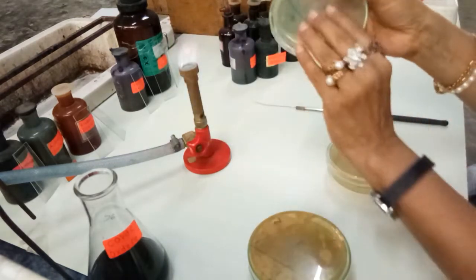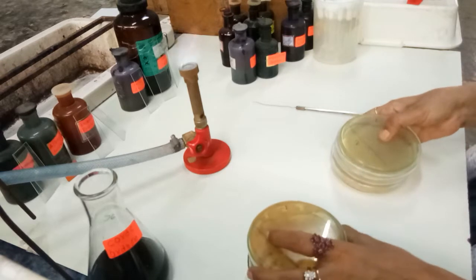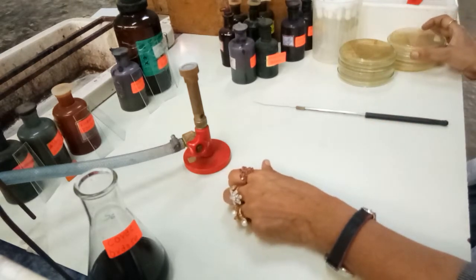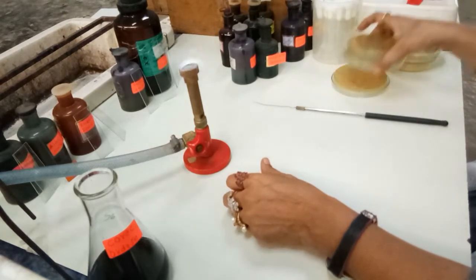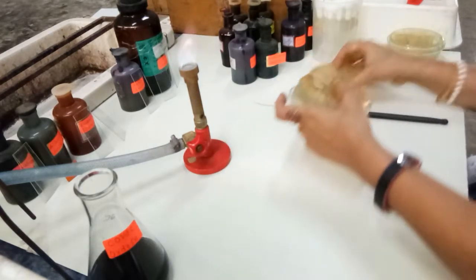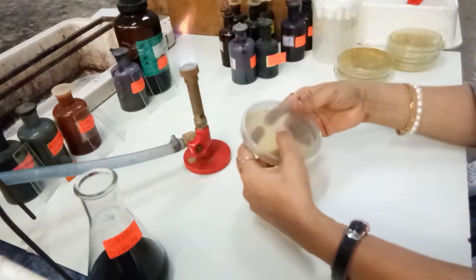So I think that it should be incubated for a longer time period, and maybe because of the fluctuation of the temperature the colonies could not grow properly. Okay, now the very first thing we are going to do will be, we will take the best plate from all of these three plates of MRS media. The best result is seen in case of the milk sample. So we will select one particular plate of milk as a natural sample here, and now we will proceed further in a detailed manner.